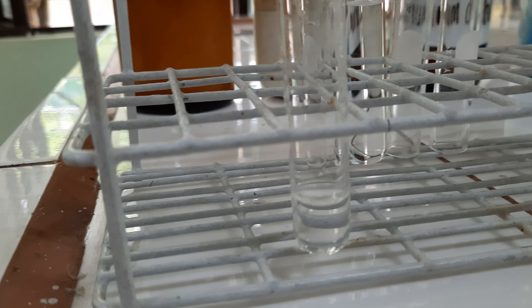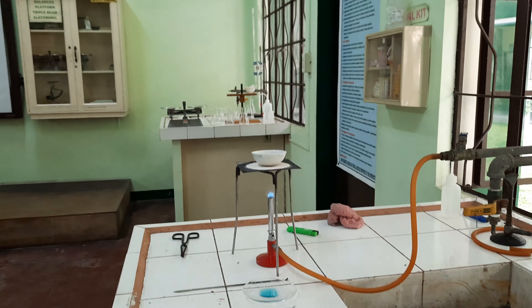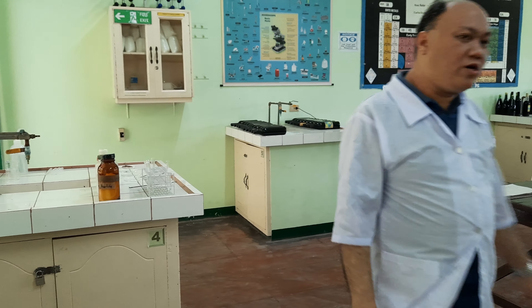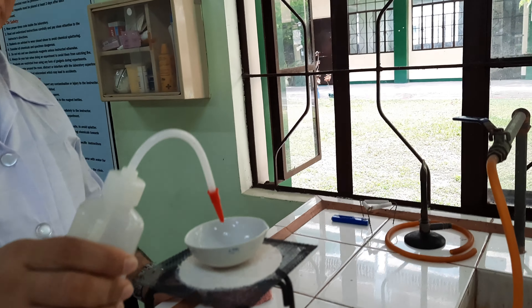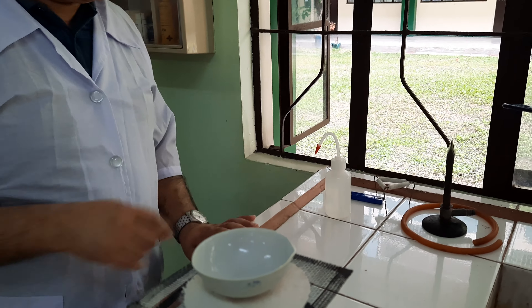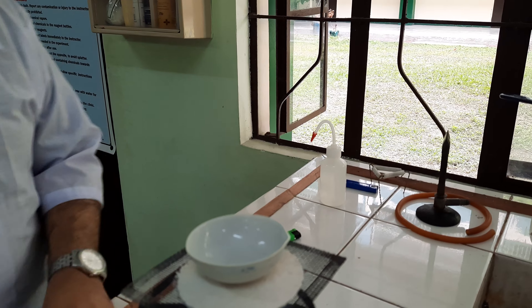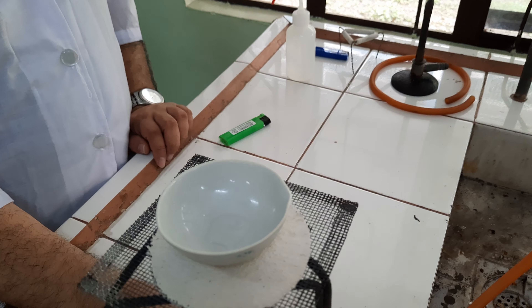Let's go back to this. I put a small amount of water on our evaporating dish. So we are heating our evaporating dish. On a heated evaporating dish, I will put a small amount of water. Note what will happen to water as we continue the heating.